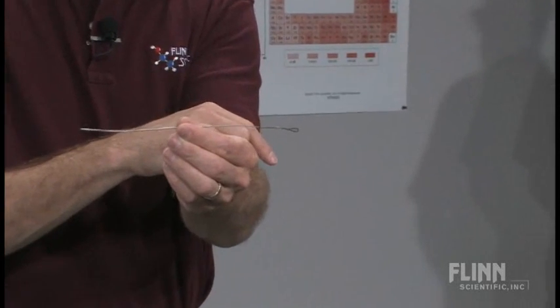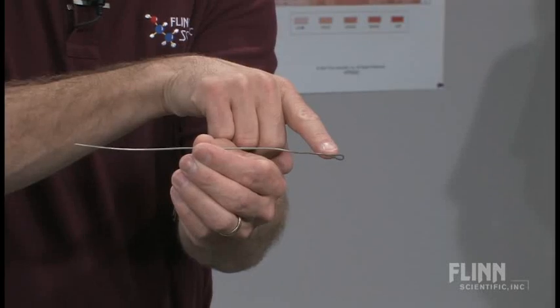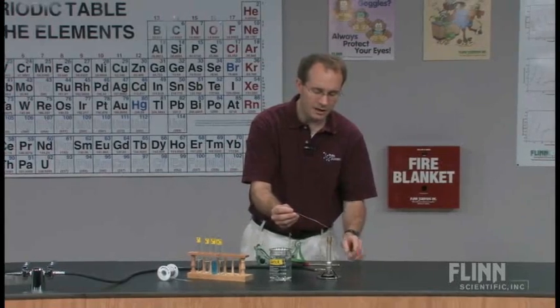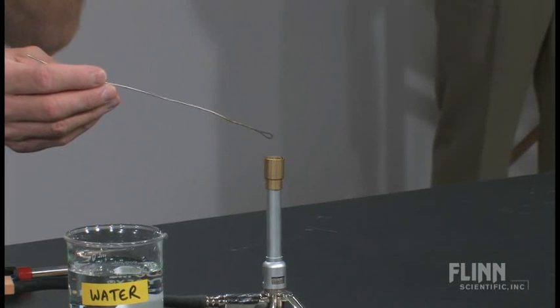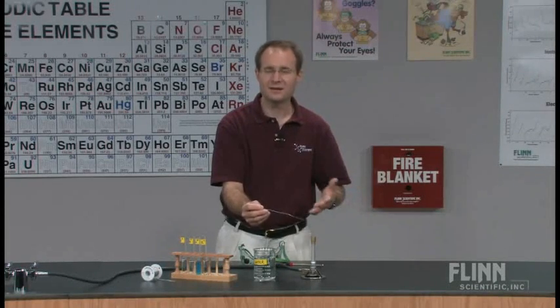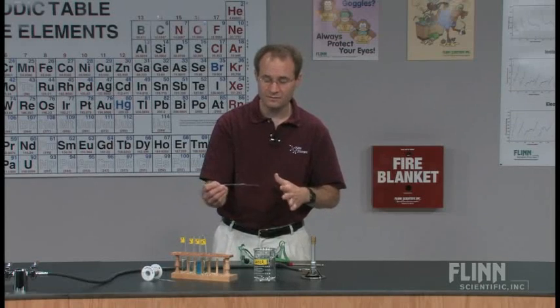What's amazing about this — and it always surprises the students when I demonstrate the procedure — is that I can heat the looped end of the wire, put it right in the Bunsen burner flame, and this part can get just orange hot, incredibly hot, and yet I don't feel that heat out here where my hand is. Students will ask, isn't that getting warm? — which is a good question, because many times metals are very good heat conductors. That is not the case with nichrome wire, making it perfect for flame tests.